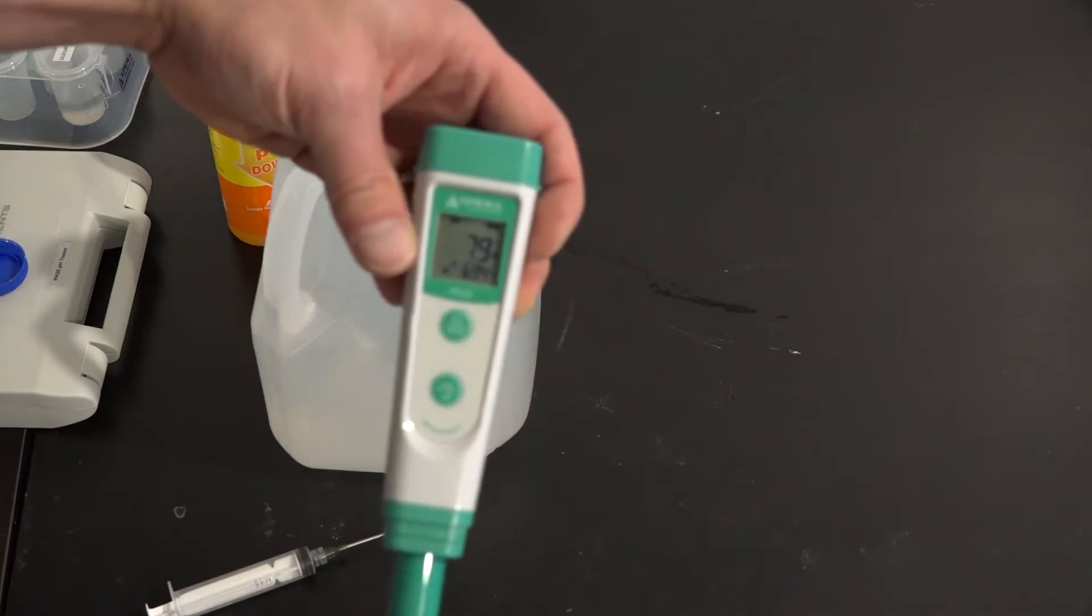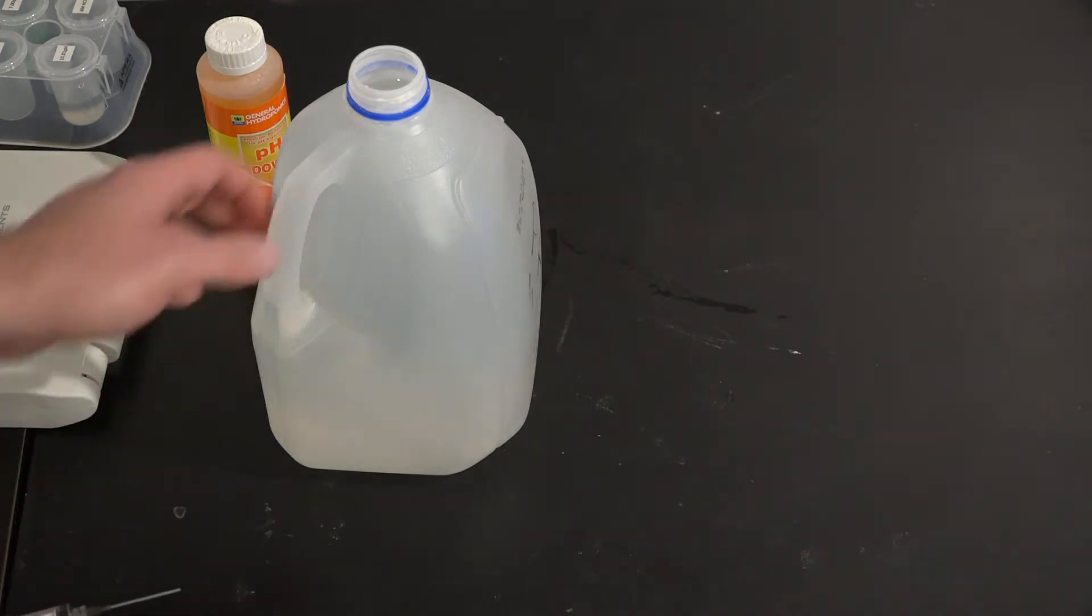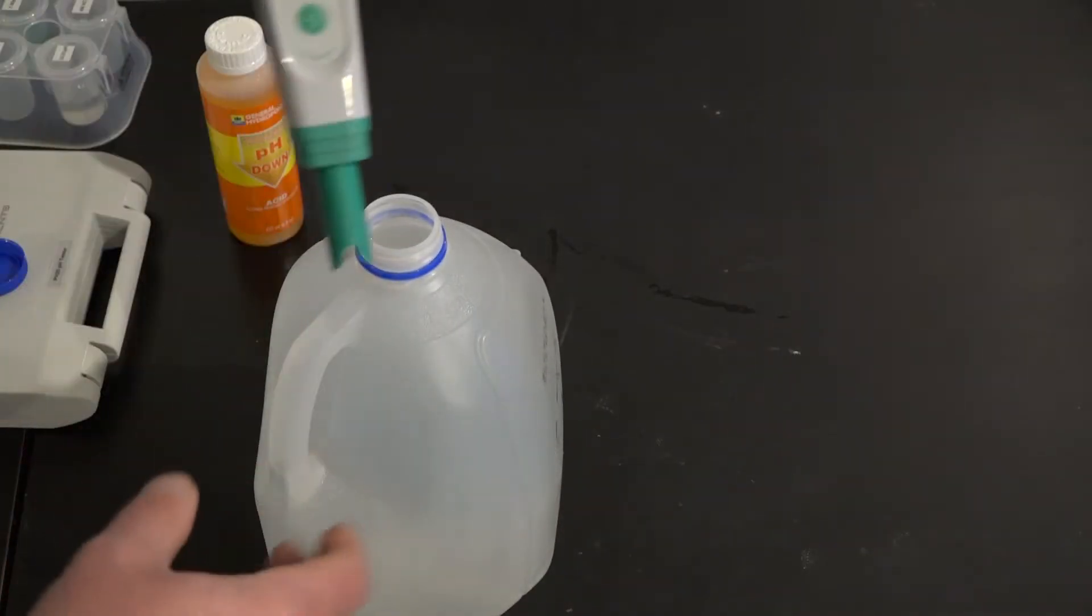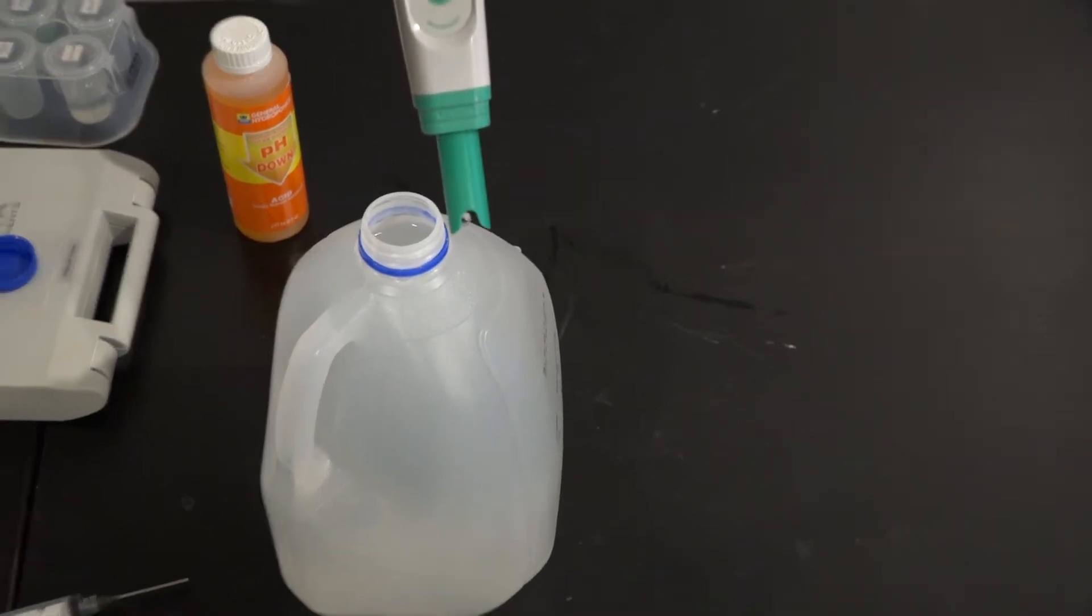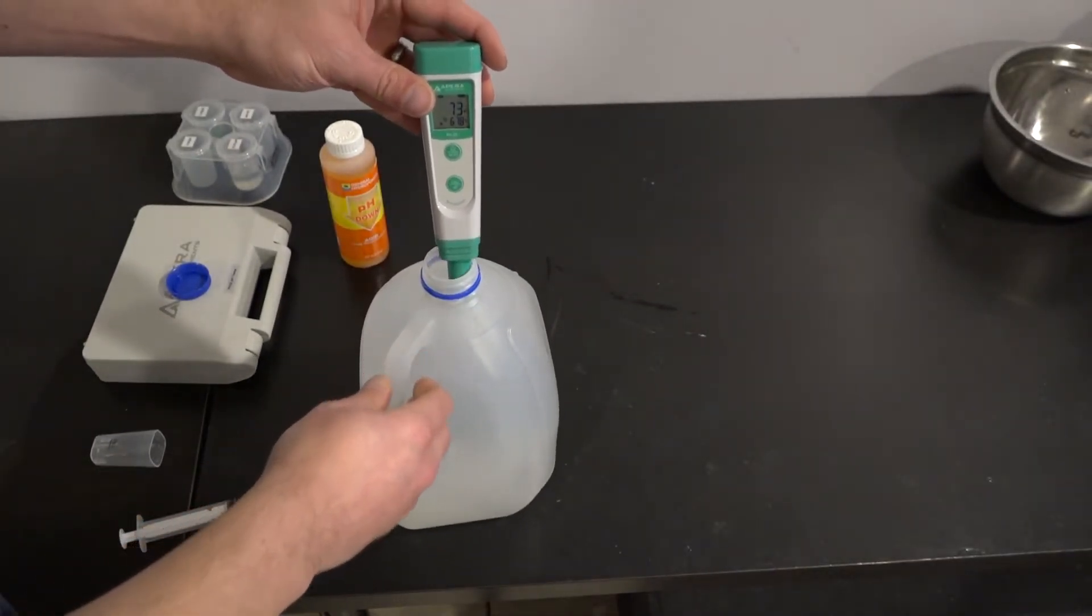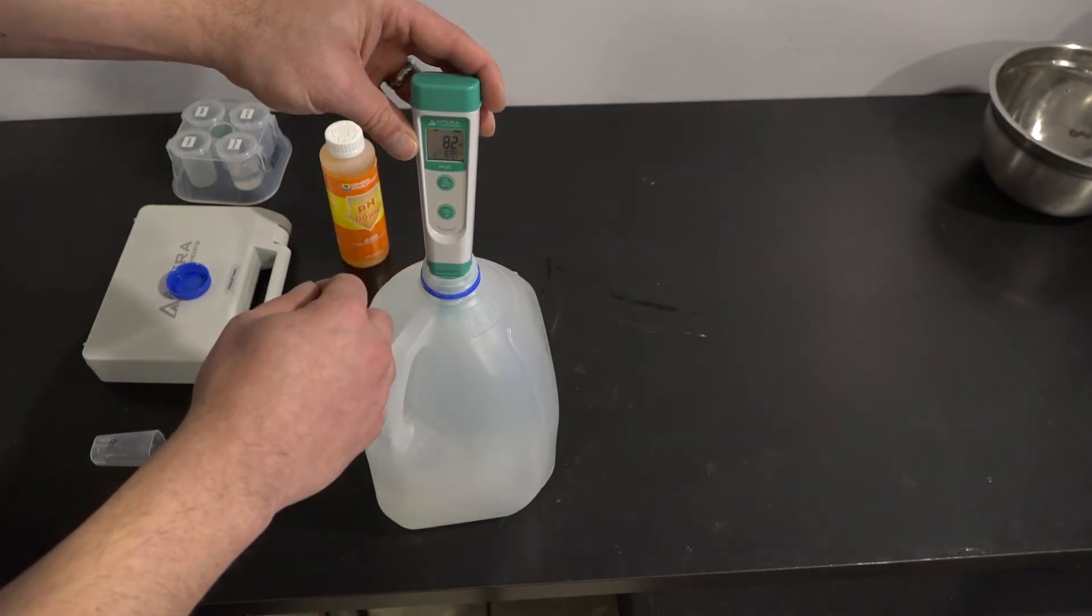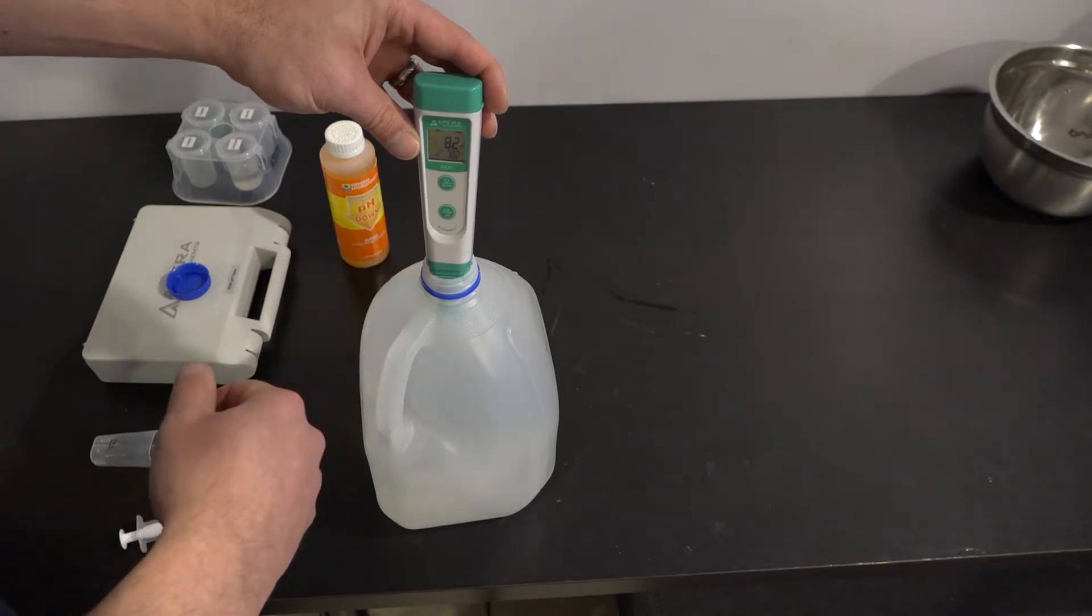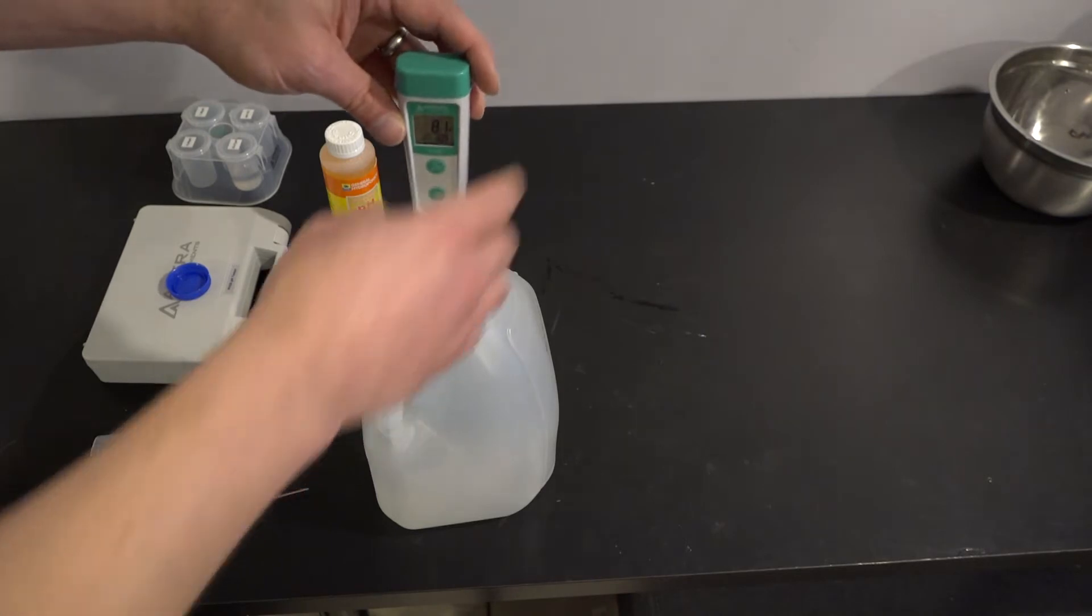And it says I'm right about 8.0. I'm going to check that again. This time, I'll do it so that you can see the readings. So, dropping it in. 8.2. It's holding between 8 and 8.2. Let's call it 8.1.